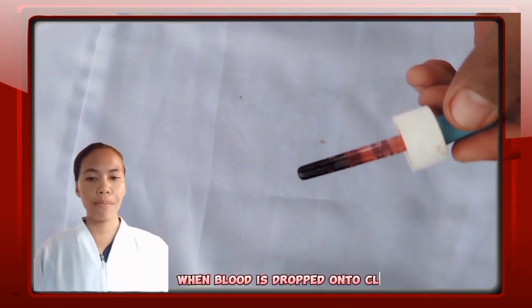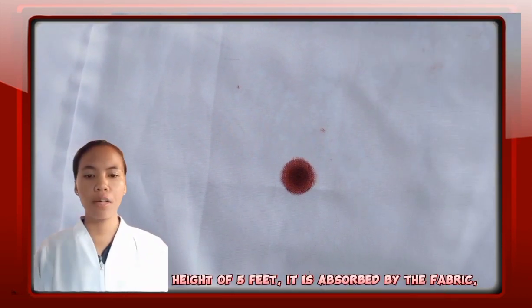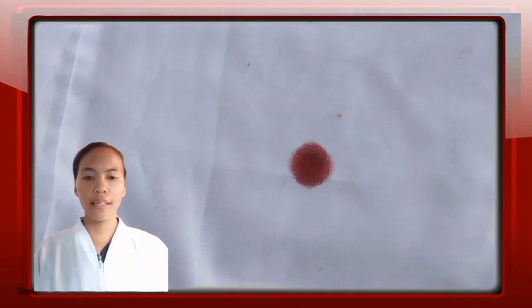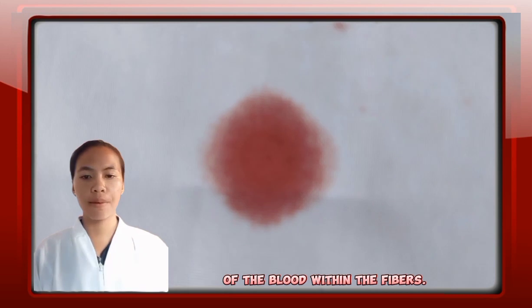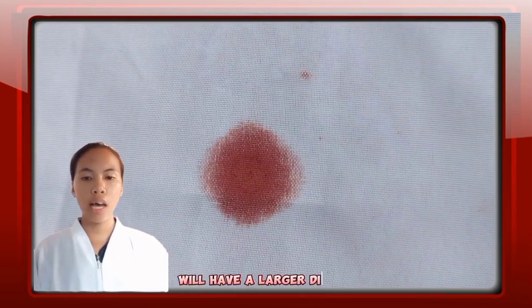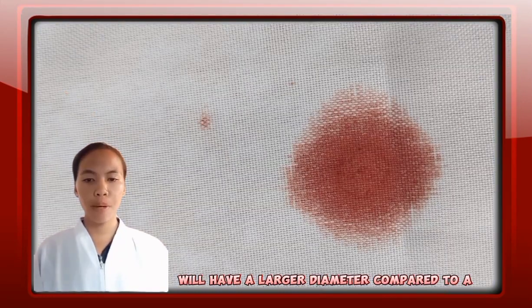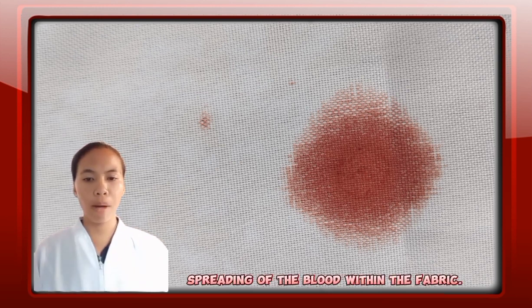When blood is dropped onto clothing from a height of 5 feet, it is absorbed by the fabric, leading to the spreading and saturation of the blood within the fibers. As a result, the blood stain on the clothing will have a larger diameter compared to a smooth surface due to the absorption and spreading of the blood within the fabric.